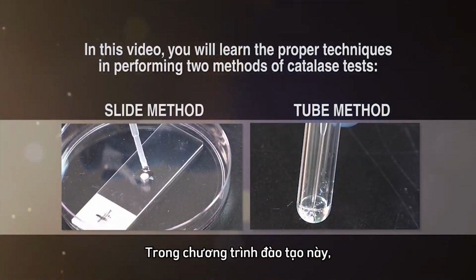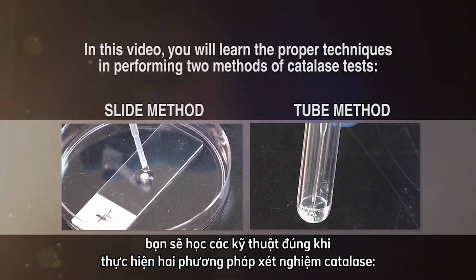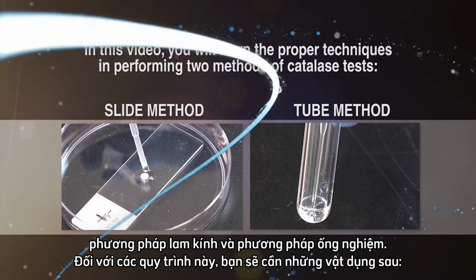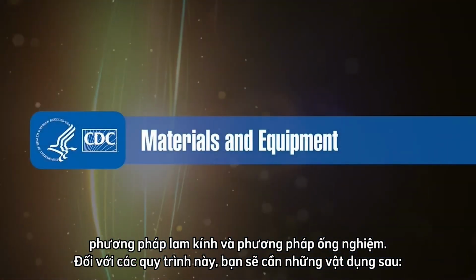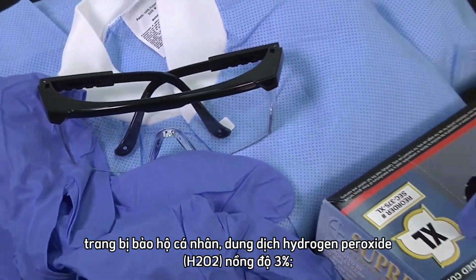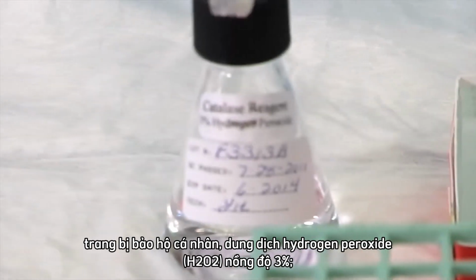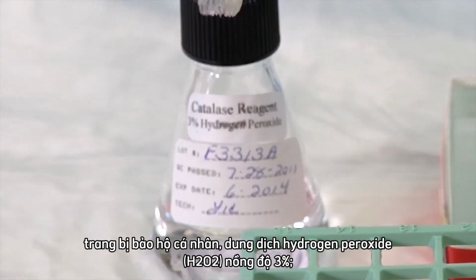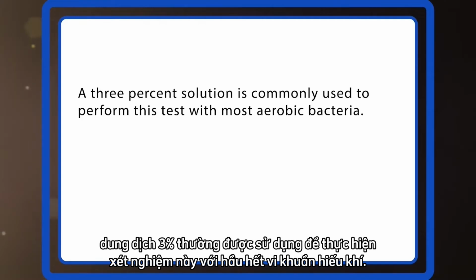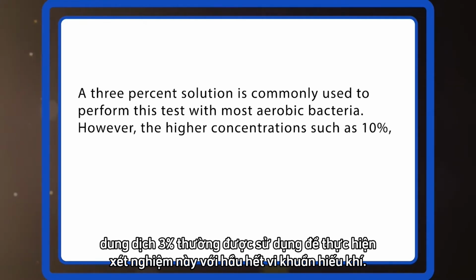In this training program, you will learn the proper techniques in performing two methods of catalase tests: the slide method and the tube method. For these procedures, you will need the following: personal protective equipment, a 3% solution of hydrogen peroxide, H₂O₂. A 3% solution is commonly used to perform this test with most aerobic bacteria.